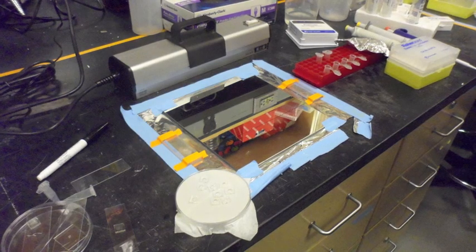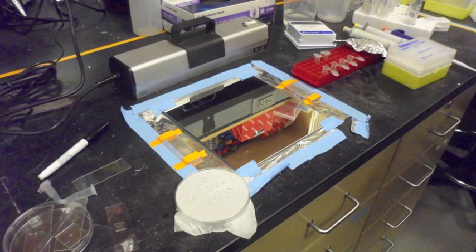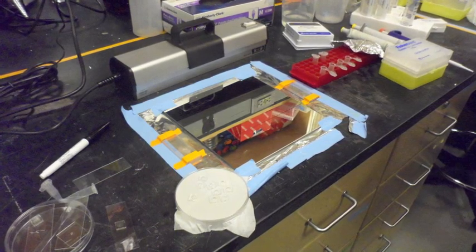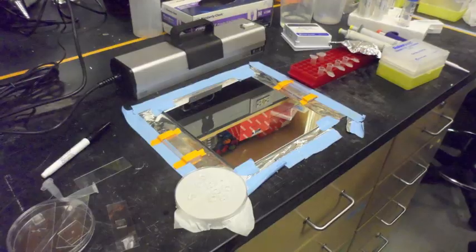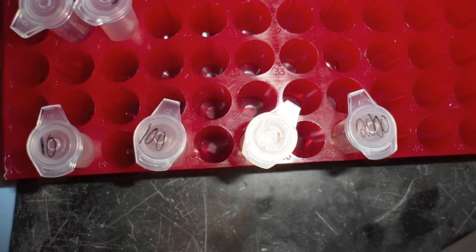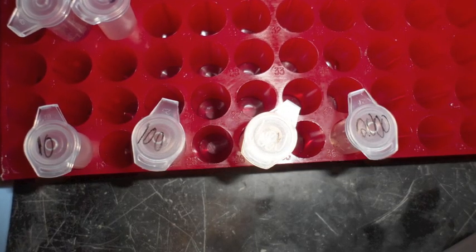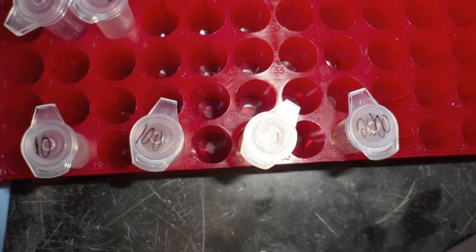This video will go through how to do a proper DNA-DNA hybridization procedure using the PEG hydrogel microparticles. To begin with, divide the microparticle into five aliquots, remembering to label them.